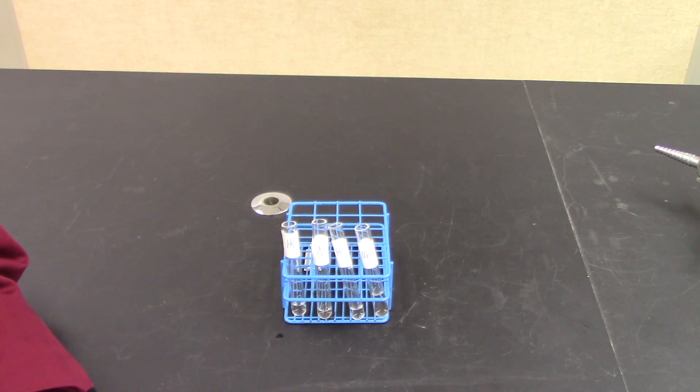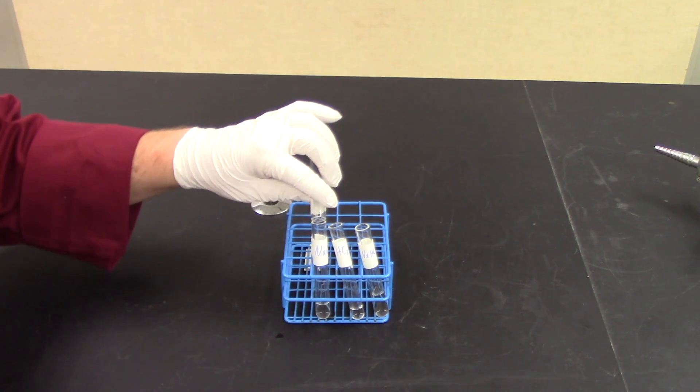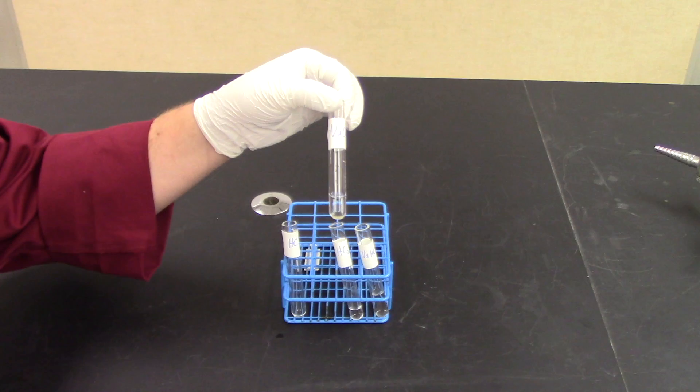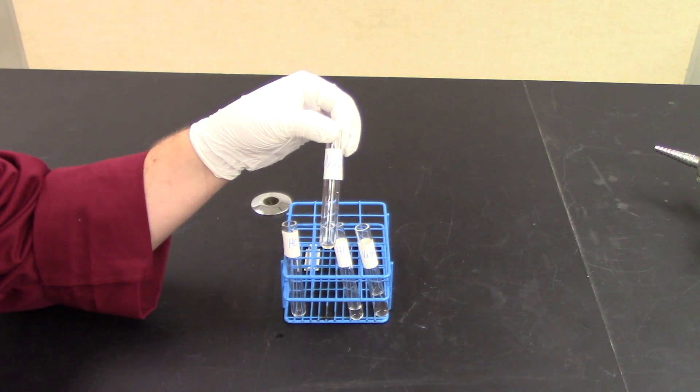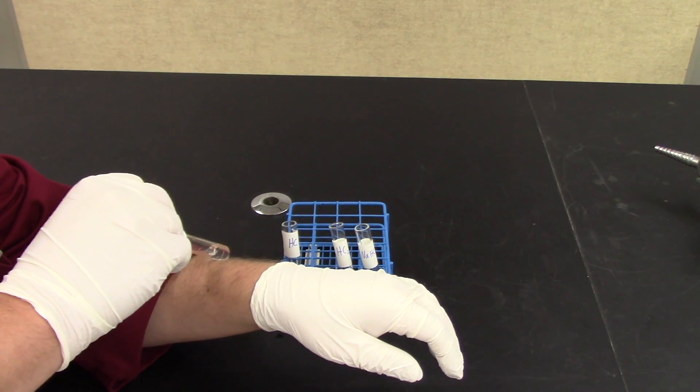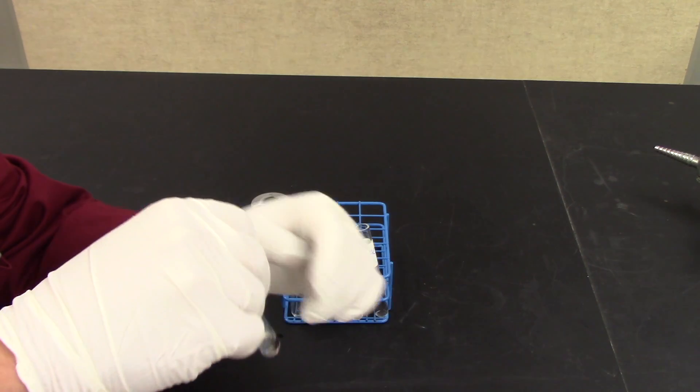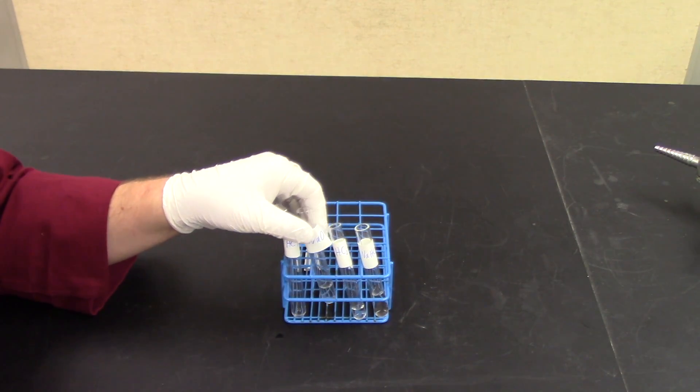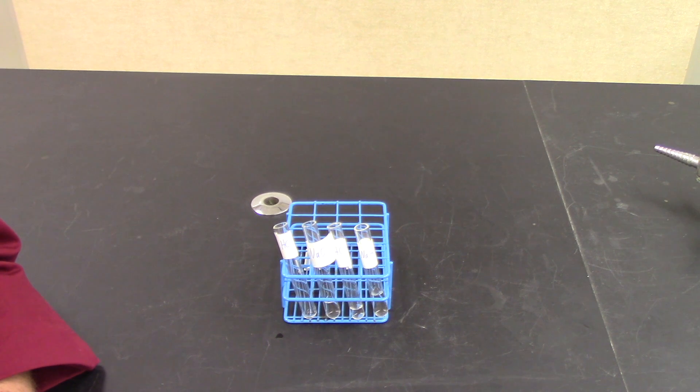Continuing with part three, once you have the reagents back at your desk, read the manual carefully to ensure you're mixing the correct reagents in the correct proportions. Once you are assured that you're mixing the right things together, take one of the test tubes and pour it directly into the other, and look for a chemical reaction. Remember that a chemical reaction may not involve a color change or precipitates or bubble formation. It may simply be the reaction gets hot. To check to see if it's getting hot, take the test tube and rub it on the back of your arm or onto your fingers to see if you can feel any kind of heat coming off of the test tube. That heat could be indicative of a chemical reaction. If you don't see any bubble formation and there's no heat evolving, it could be that there's no reaction. So simply report no reaction.